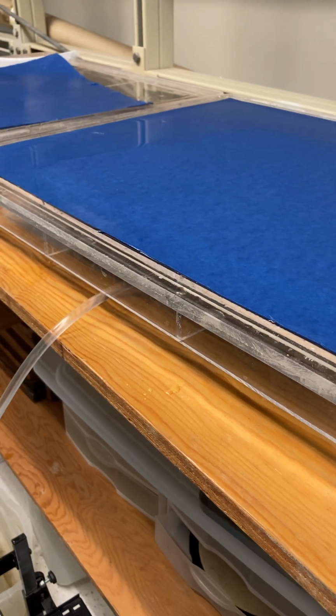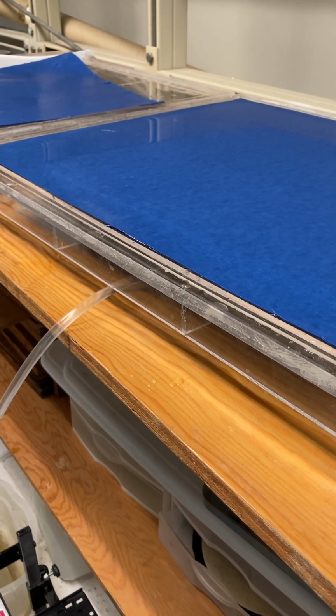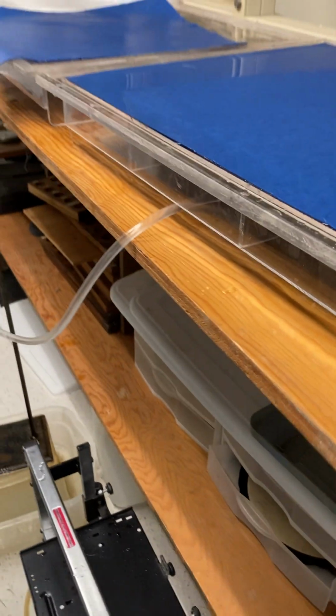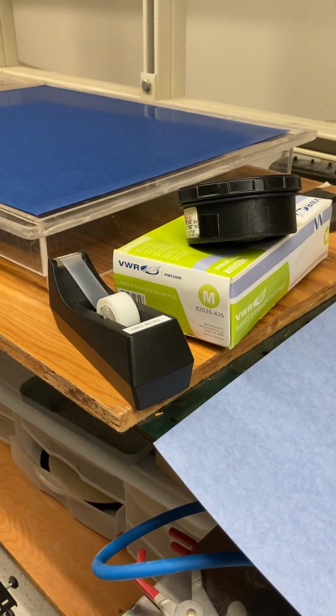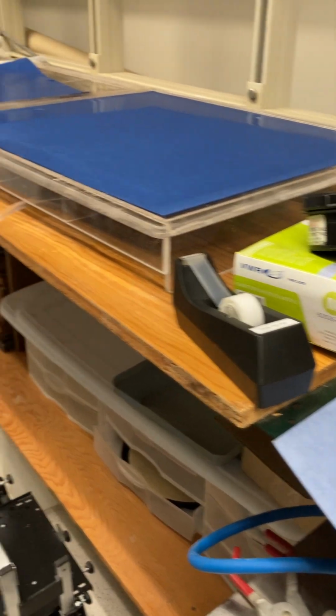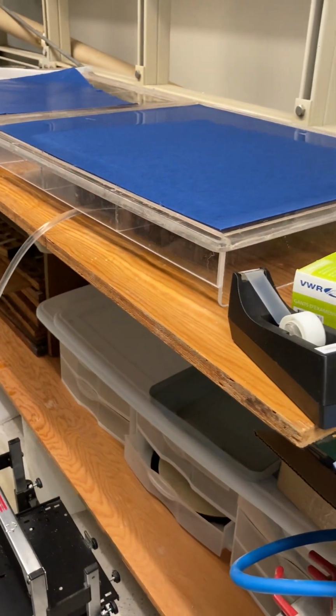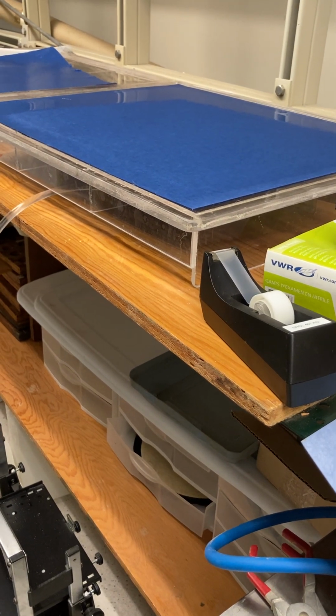Yeah, if we get this set up, I probably wouldn't move this. I would just leave it. You can have the students maybe come up here to see it if you want to demonstrate. Yeah, she just has quite a large class size, so I don't know. You can maybe take them in groups. You can do what you want, but that's what I would do. Because if you take this down, once it's working, you run the risk of not being able to get it up and running again.